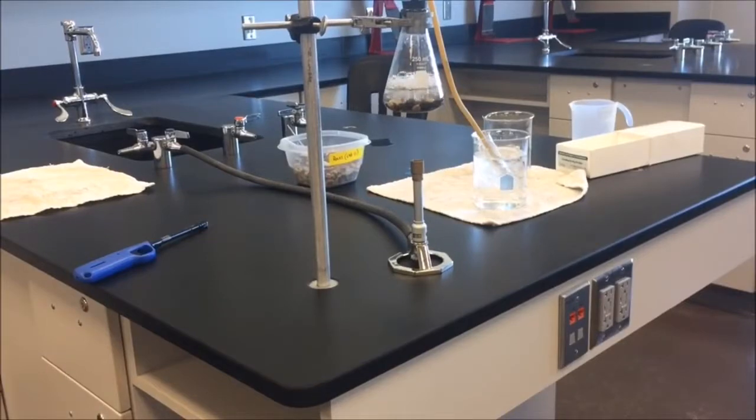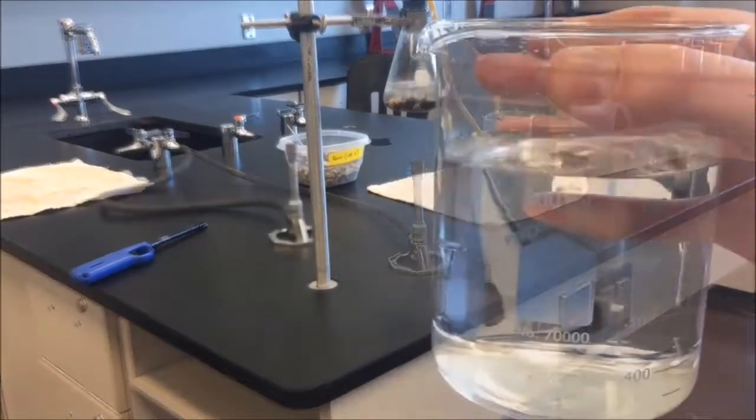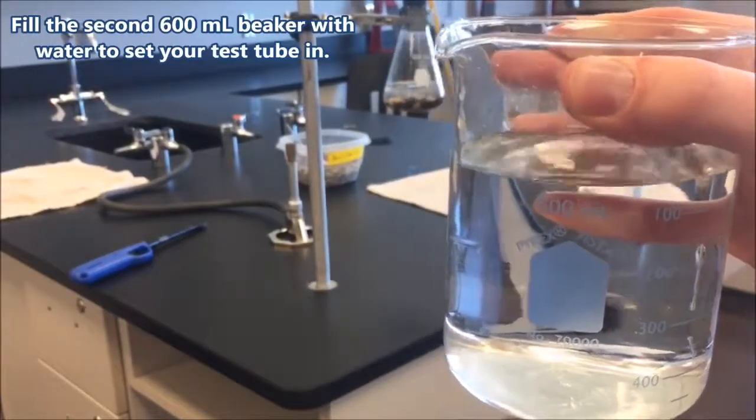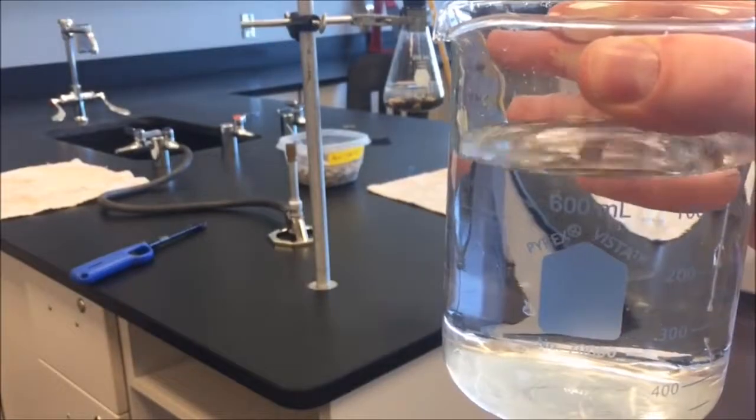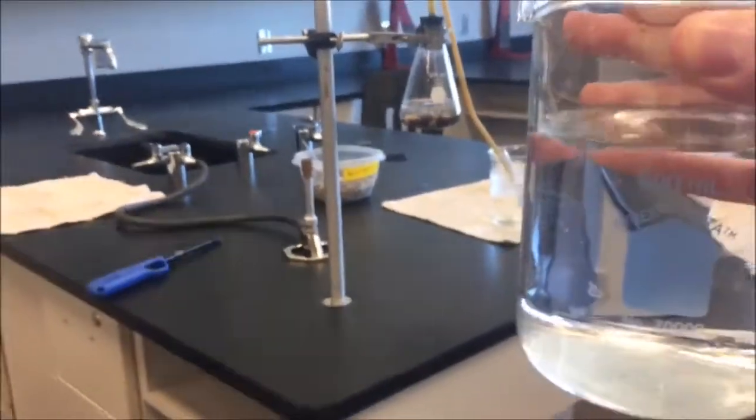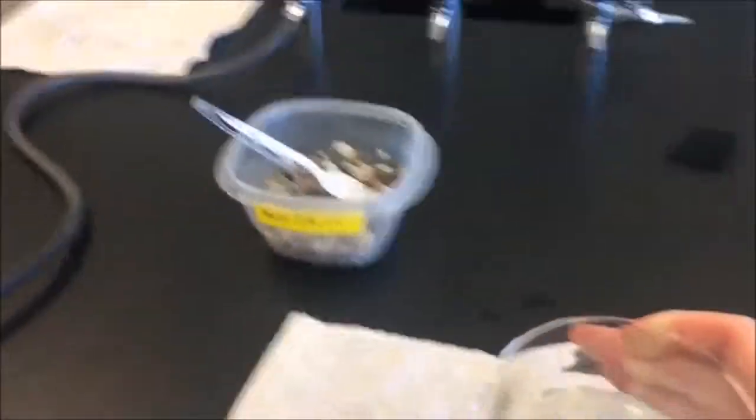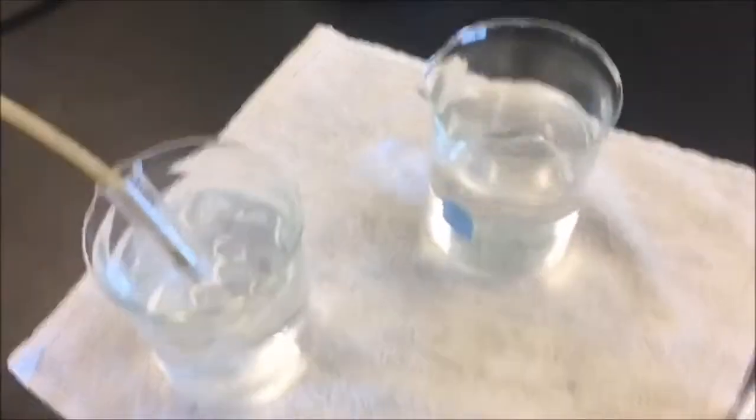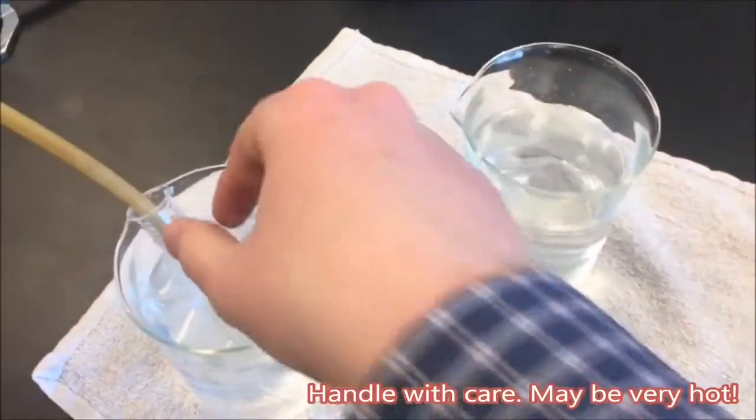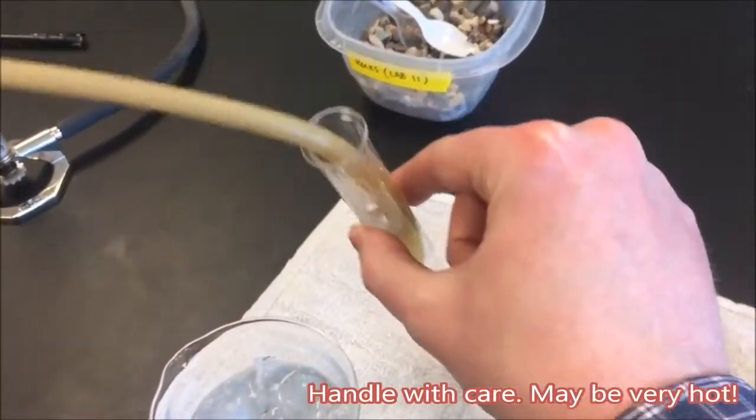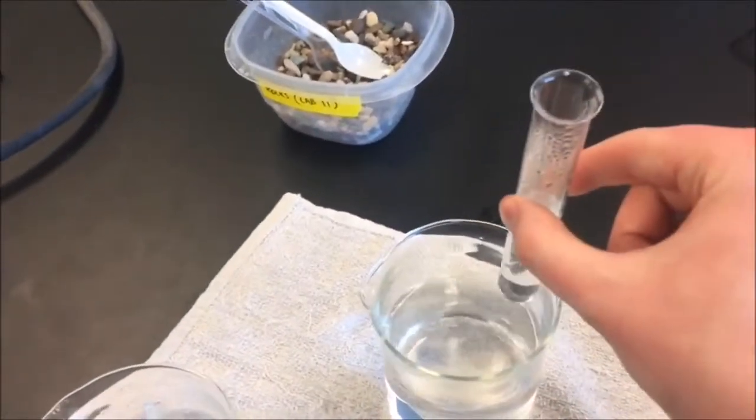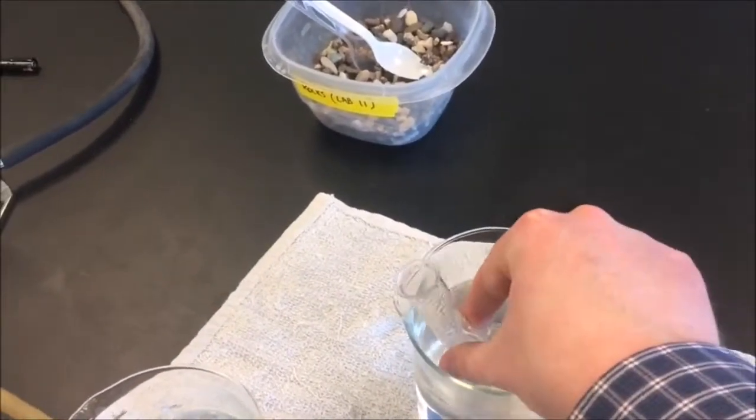Once you're happy with how much water you've filled in your test tube, let's go ahead and turn off the gas. So while I was waiting for it to cool, I filled up another beaker, one of the 600 milliliter beakers with some distilled water. And what I'm going to do now, being very careful so I don't burn myself, I'm going to take out the test tube and transfer it over into the distilled water beaker.